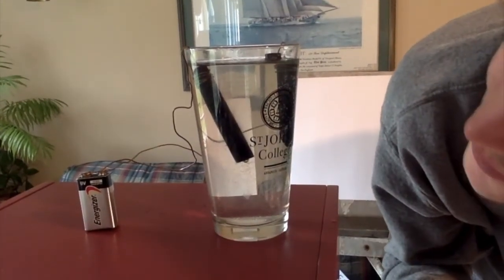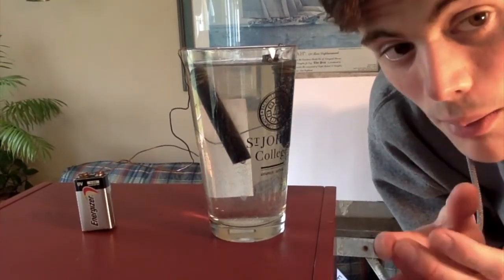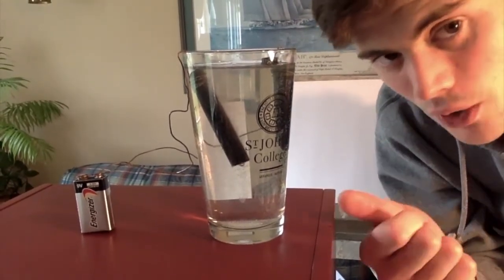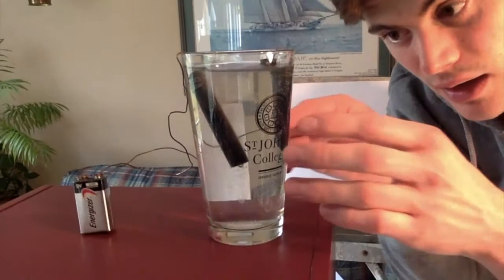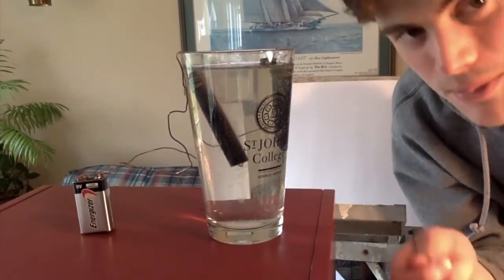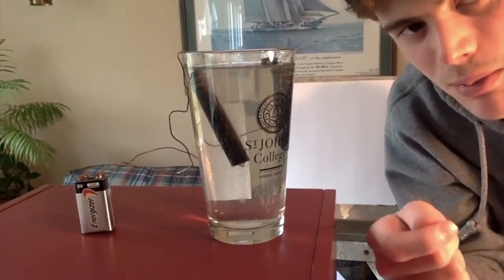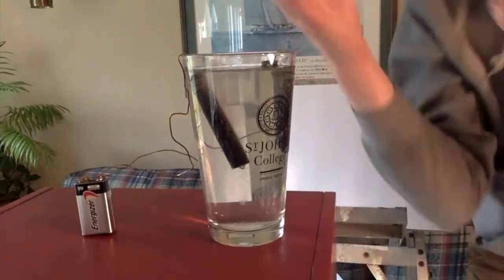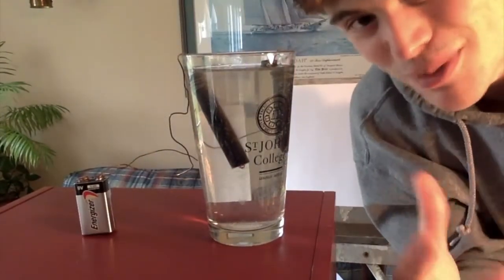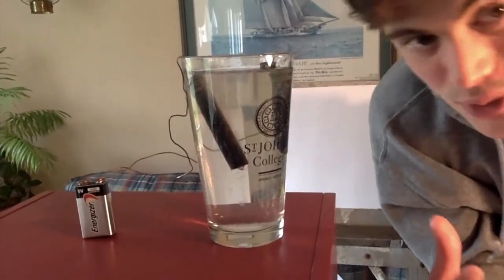Oh, give it a moment to restart. There you go. All of those small bubbles there, that's all hydrogen gas. Those are all of the hydrogens that were, just a moment ago, attached to the oxygens in this glass of water. So this is something that you never see happening out in nature. Water molecules splitting apart, separating into hydrogen and oxygen. But right now I'm actually creating so much hydrogen here that you can really smell it. It's very strong. It smells a little bit like chlorine in a pool almost.